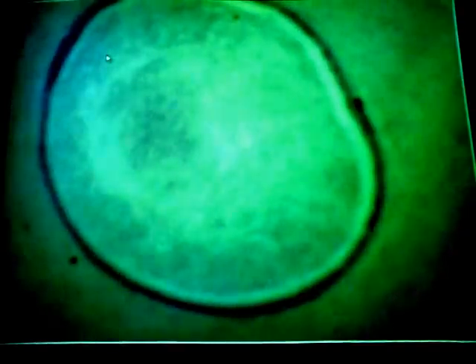Now the epididymis consists of a bunch of tubes. You see some of them here, cut in section. This big mass in the middle here is sperm cells. I'd like you to know the structure of these tubes, and you can follow along on your lab objective sheet. This is on your first page there, under epididymis. Everybody see that at the top? All right, first it lists the epithelium that lines the tubes. That's what this purple layer is.